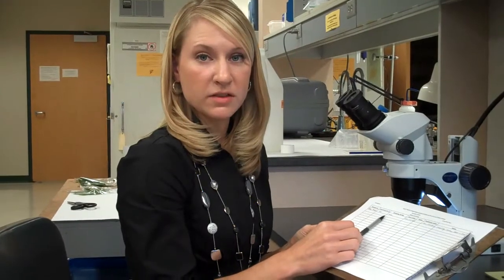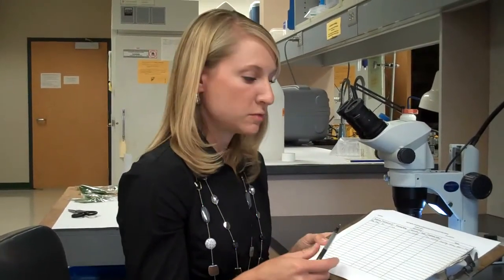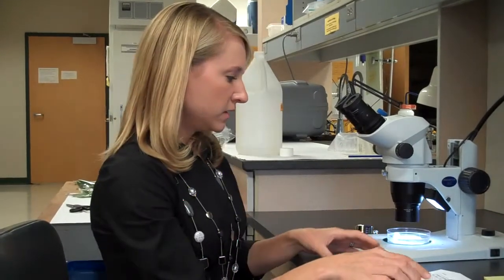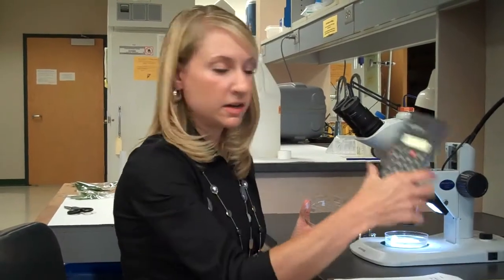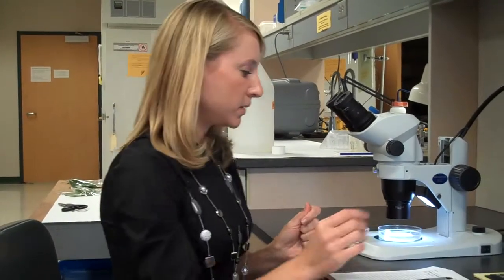Record symptoms you see on the leaves along with counts for rust mites, thrips, and predatory mites — three organisms I tend to look for because thrips can also cause damage on grapevine tissues similar to rust mites, while predatory mites are beneficial that we want to keep track of. If you find very high numbers in one area, you may choose to count random areas on a gridded petri dish and use a calculation to determine what percentage of total surface area your counts represent.